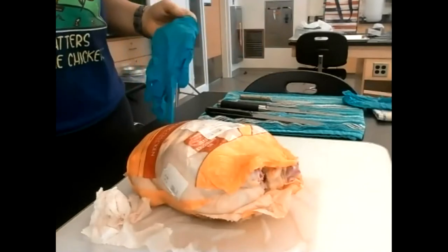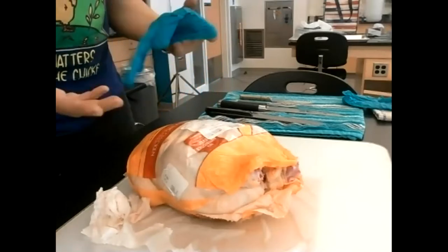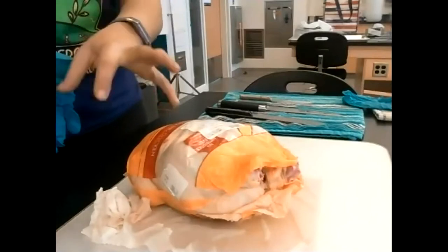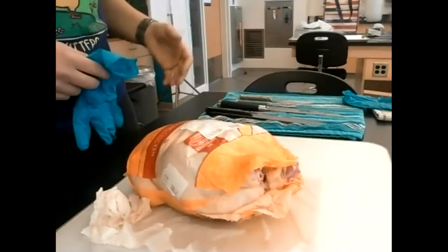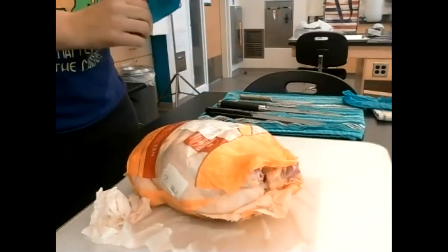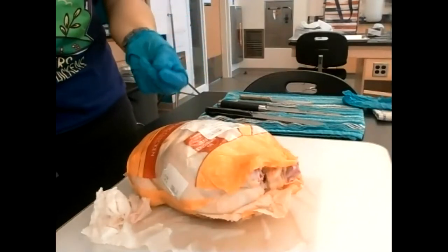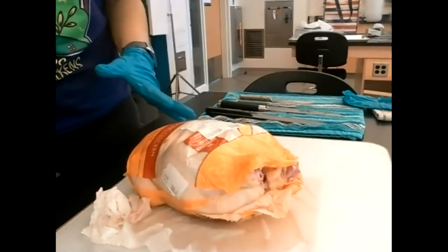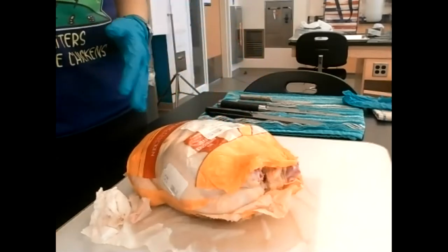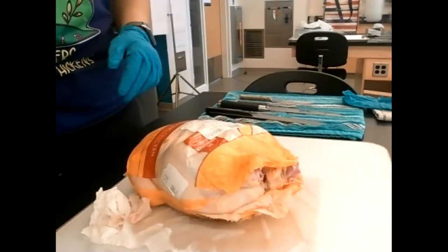You do not have to use gloves. Whenever I am preparing or butchering meat I don't use gloves. I'll use one glove today so I can touch the computer without getting bacteria on it. I recommend not using gloves if it doesn't wig you out, because then you can actually feel the differences in the tissue types. But whatever makes you comfortable — be safe, remember which end of the blade is sharp, watch where your fingers are, and cut meat just like you would in your own kitchen.